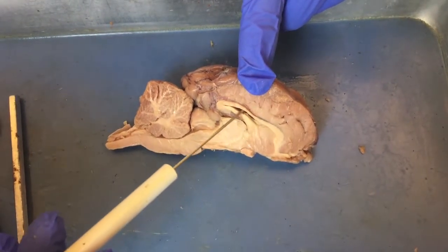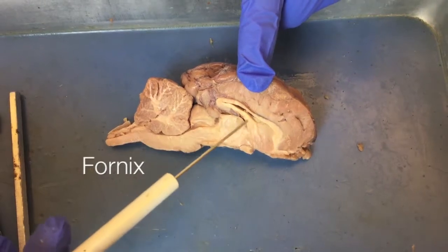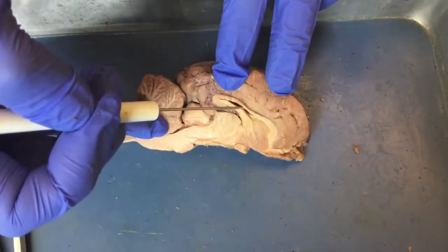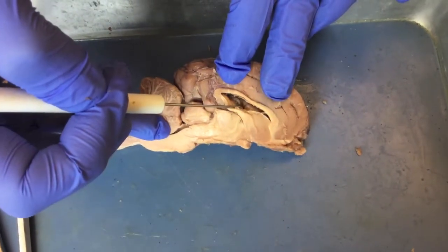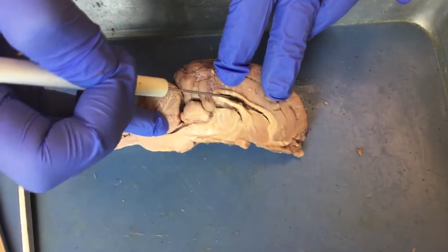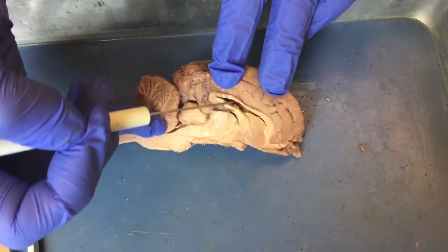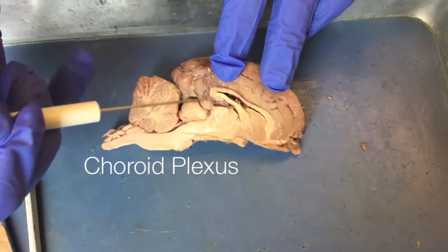Here we have the lateral ventricle, and this portion is called the fornix. Inside the lateral ventricle here, you may see some vascular matter. You can pull it out with your forceps or with your sharp probe. This vascular matter, located in the ventricles, is called choroid plexus. It makes cerebrospinal fluid.